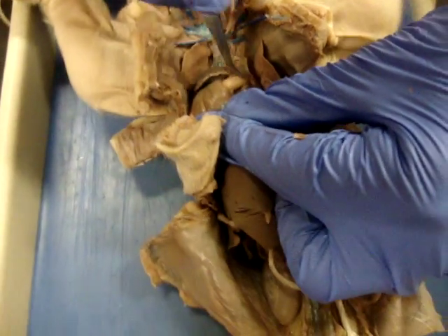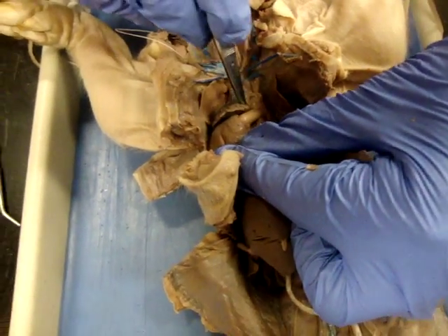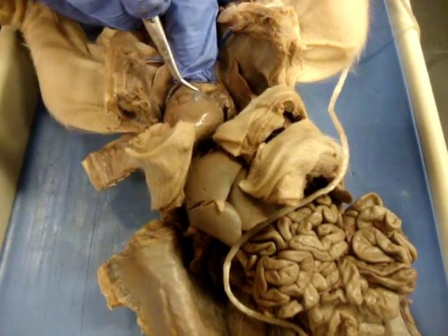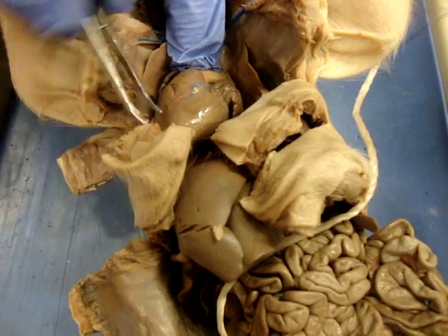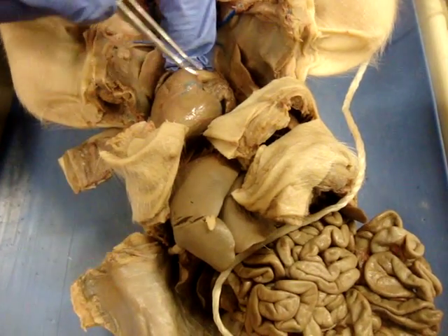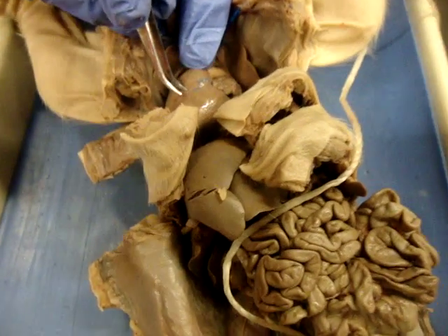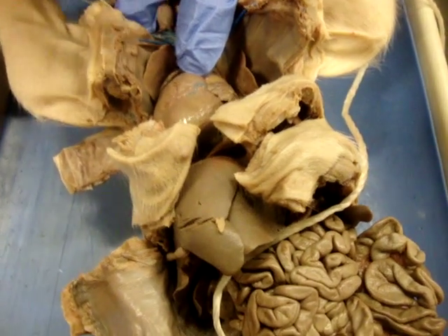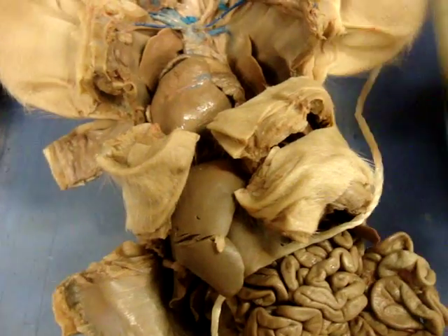You're going to have your cardiac veins. Right here, the cardiac vein is going to take blood from the heart muscle itself and transfer it back inside of the heart so that it can get oxygenated. You have your coronary arteries, which are going to feed the heart the blood that it needs. The red and the blue — pair those two things up together.